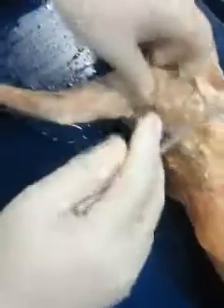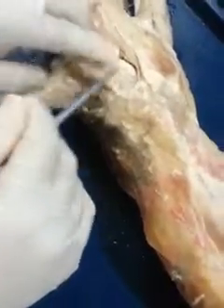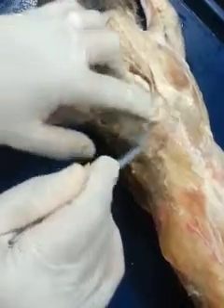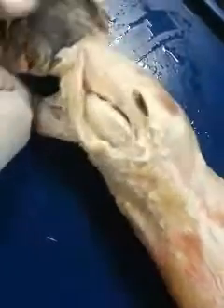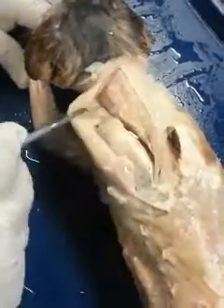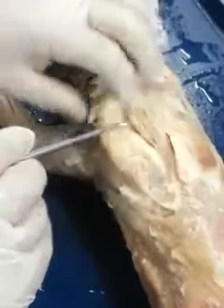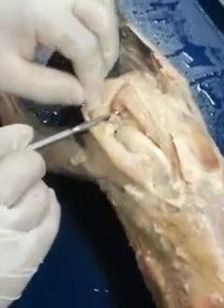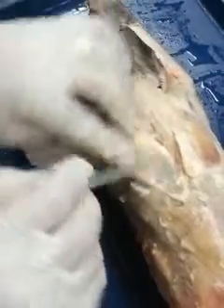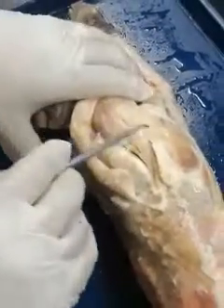Okay. If we reflect this, we can see the supraspinatus. Supraspinatus there. We could see the rhomboideus majors and minors, or slightly deeper to this. You also see the rhomboideus capitis and the splenius, the muscle deep to the rhomboideus capitis. So those are the major muscles you need to identify here.